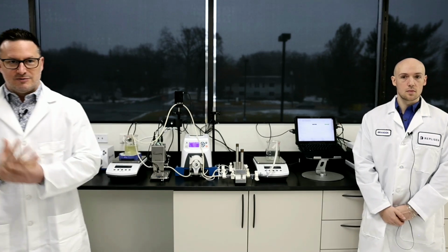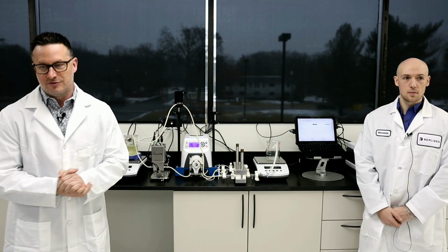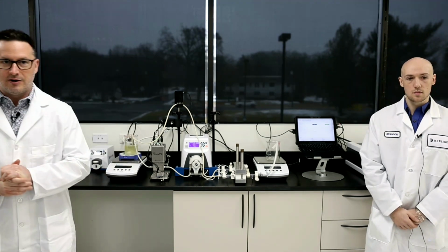My name is James Gravinsky. I'm the Analytics Sales Manager, and I'm here with my colleague Brandon. I'll let him introduce himself in a second. Hi, everyone. And so we are today just demonstrating the KR2i RPM system where we fully integrated the Flow VPX into the KR2i. Go ahead, Brandon.